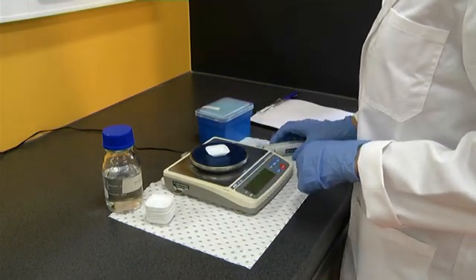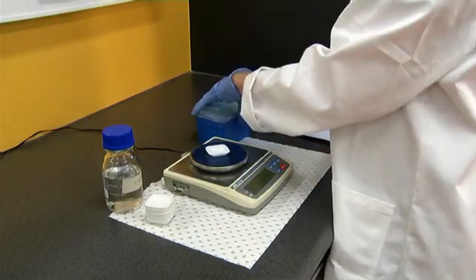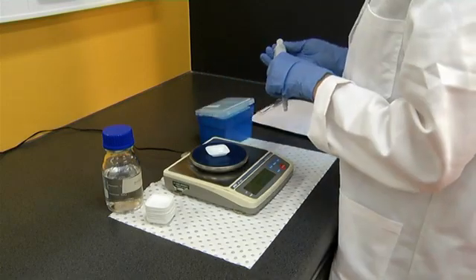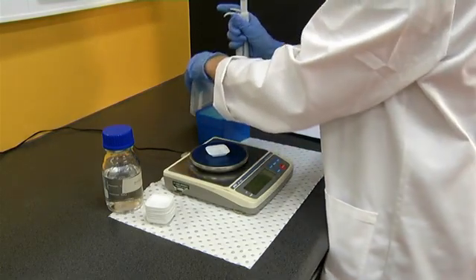Water has a specific gravity of 1. This means that 1 mL is equivalent to 1 gram.